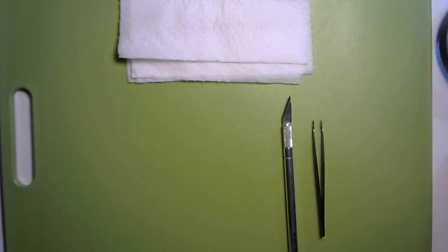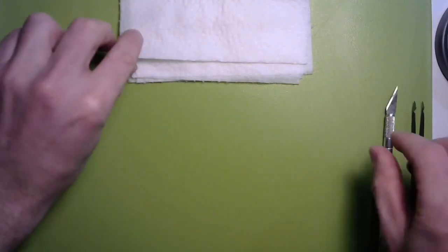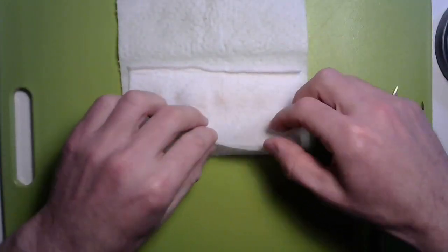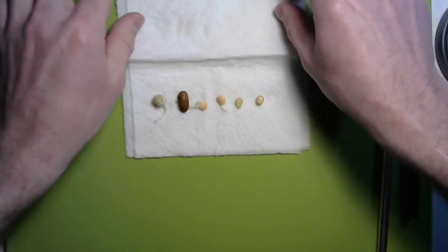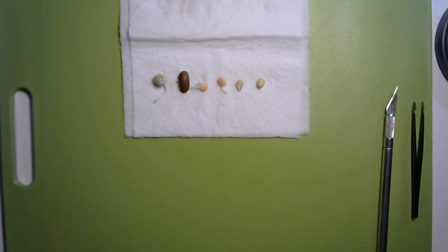I'm going to move my tools off to the side so I can concentrate on the work to be done. Let's dip into those seeds, and if you like to eat sprouts, just fight the urge to grab one of these and pop them into your mouth. This is science. Let's start with our first one.